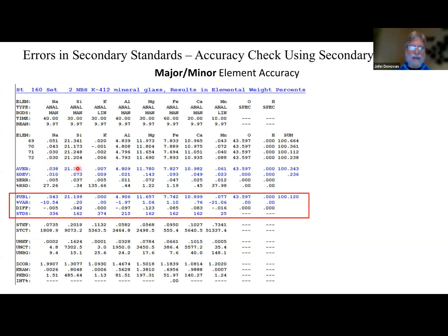Here's the average of the analysis. Here's the published value for what we believe to be the composition of this glass, and here's a percent variance. You might say, oh my gosh, 10% error, but if you'll notice, the algebraic difference here is 50 ppm, which is actually less than our standard deviation. So this is an acceptable analysis. On our silicon, we're within 0.2%.